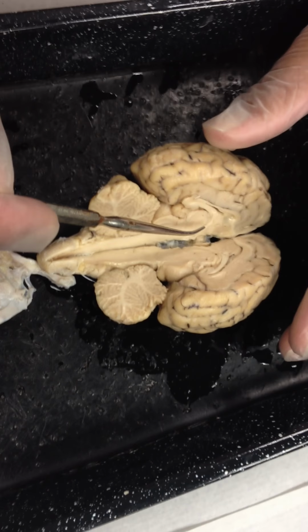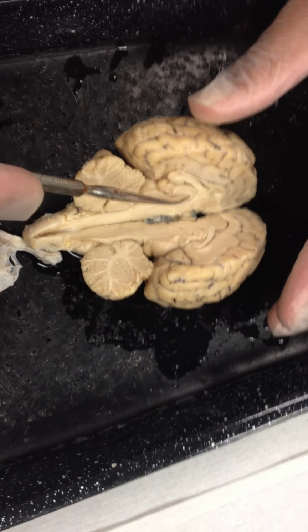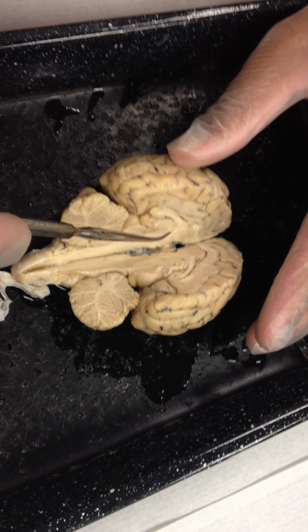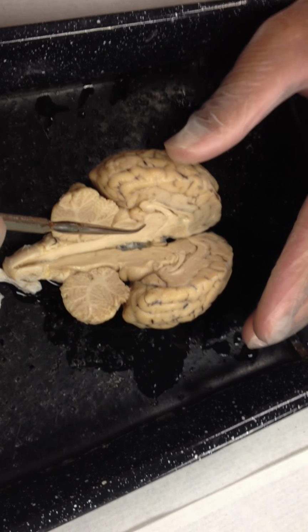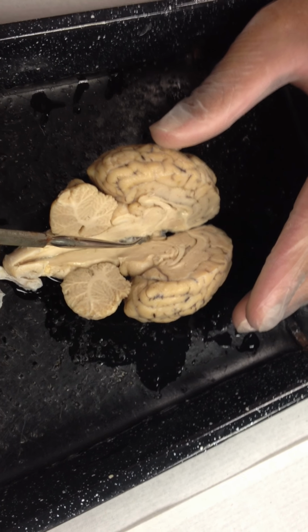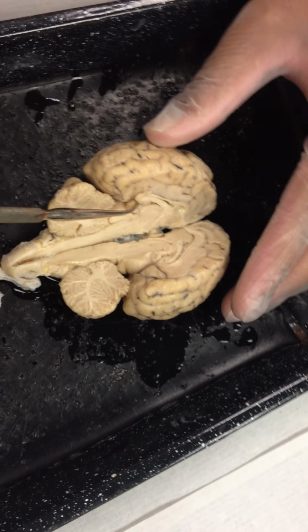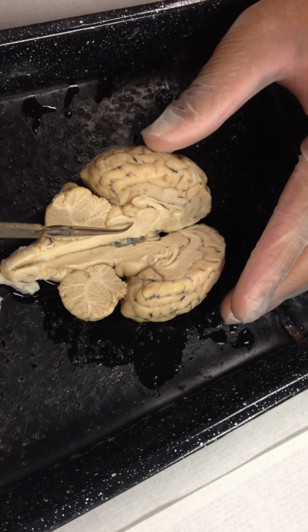The next one is the hypothalamus. Hypothalamus, hypo means below, so we would look for the hypothalamus below the thalamus. It's this region right in here, between this enlargement here and this mammillary body. That's the optic nerve, that's actually the optic chiasma. There's your grayish mammillary body, right there. The area between the optic nerve and the mammillary body, well, you have the hypothalamus.